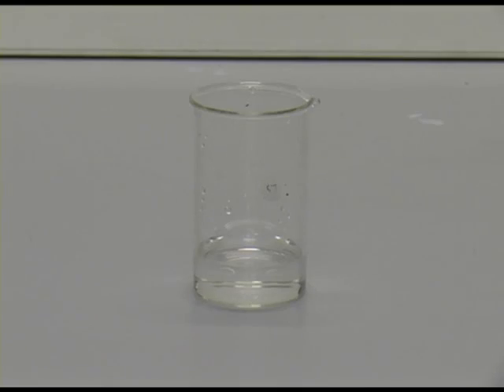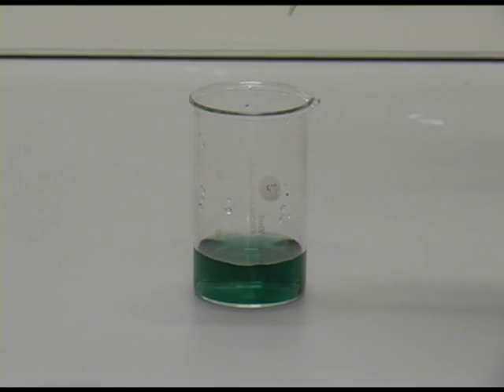After this mixture has been allowed to stand for a while, we add some universal indicator. Notice how it turns green, indicating that the acid has been completely neutralised by the carbonate.